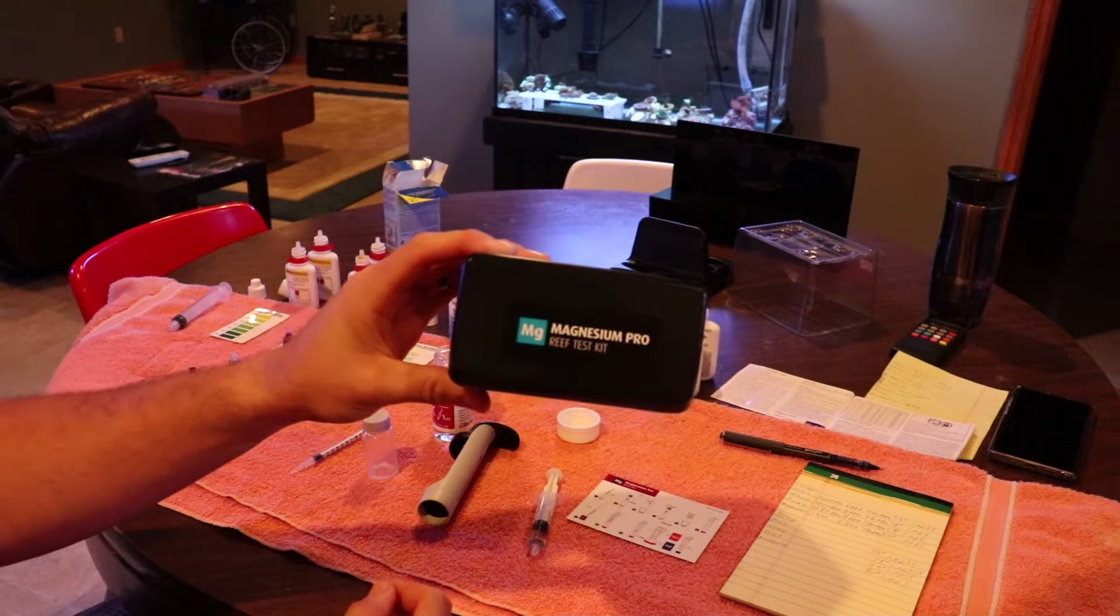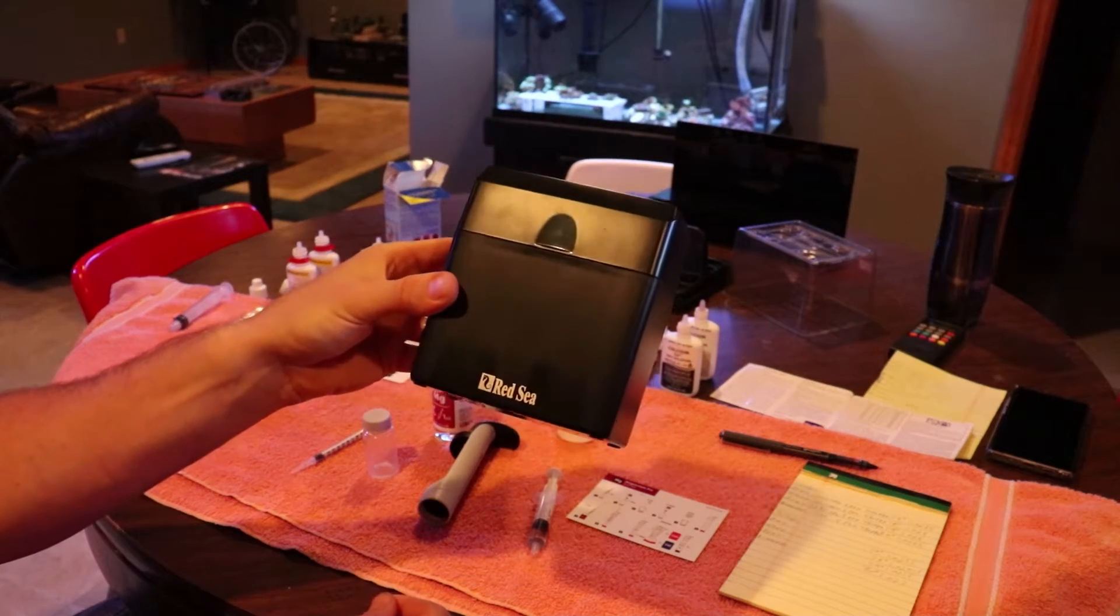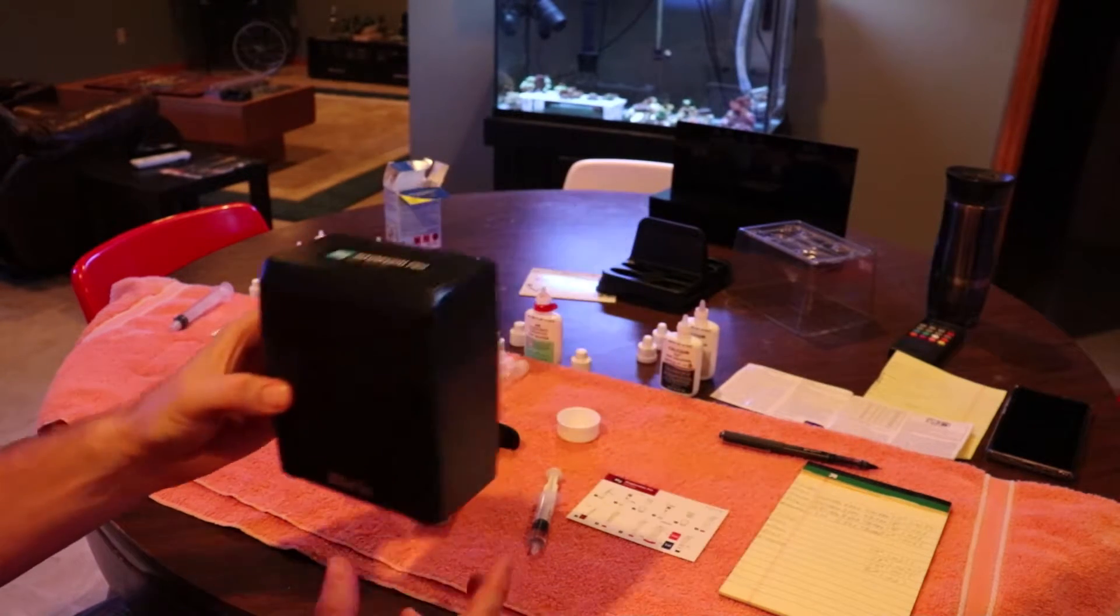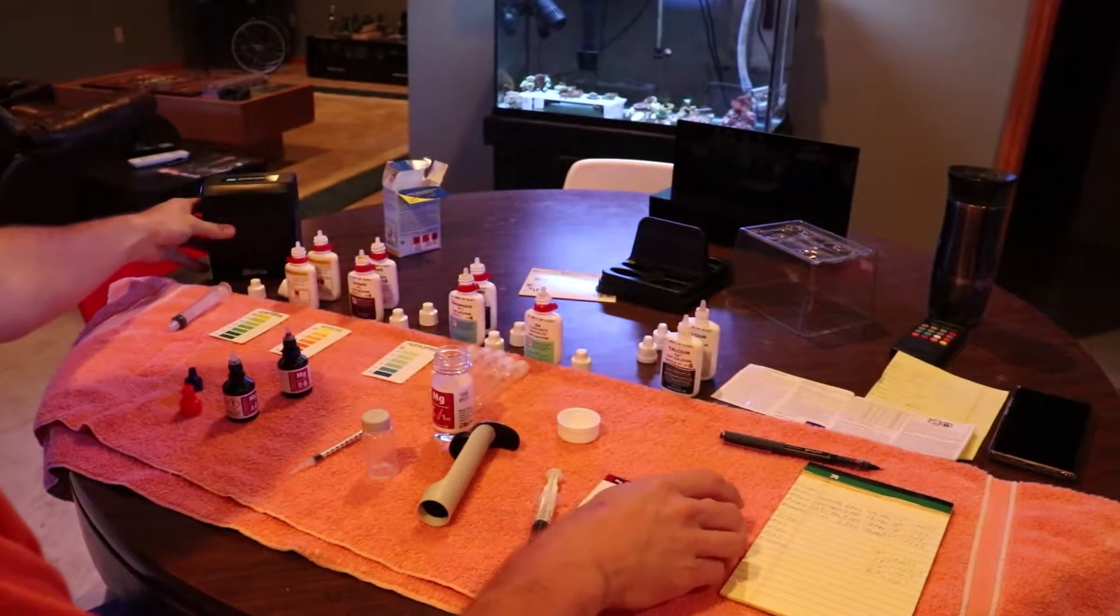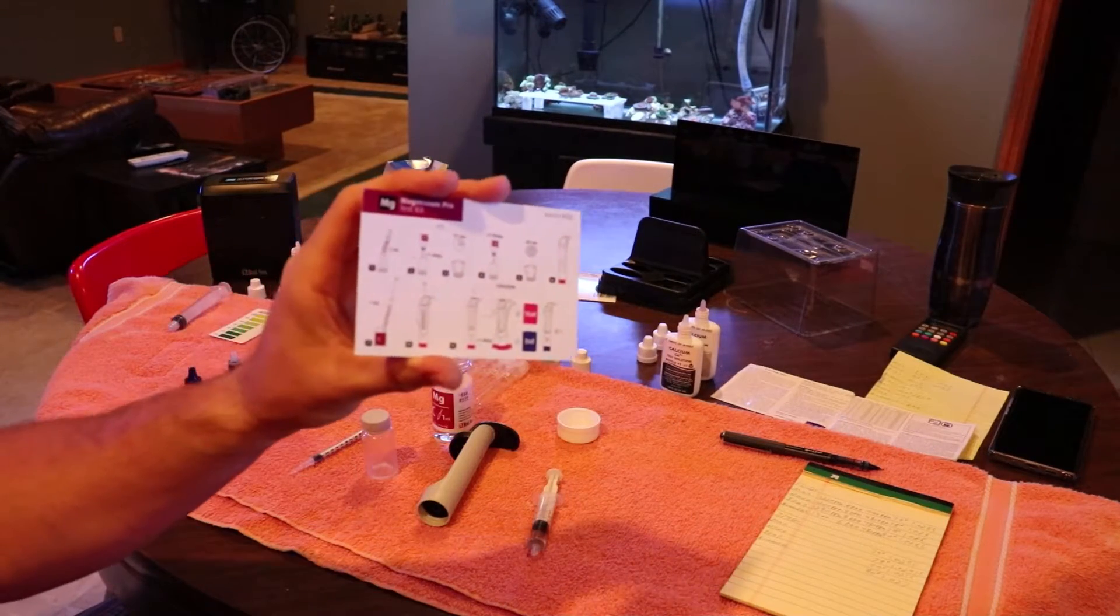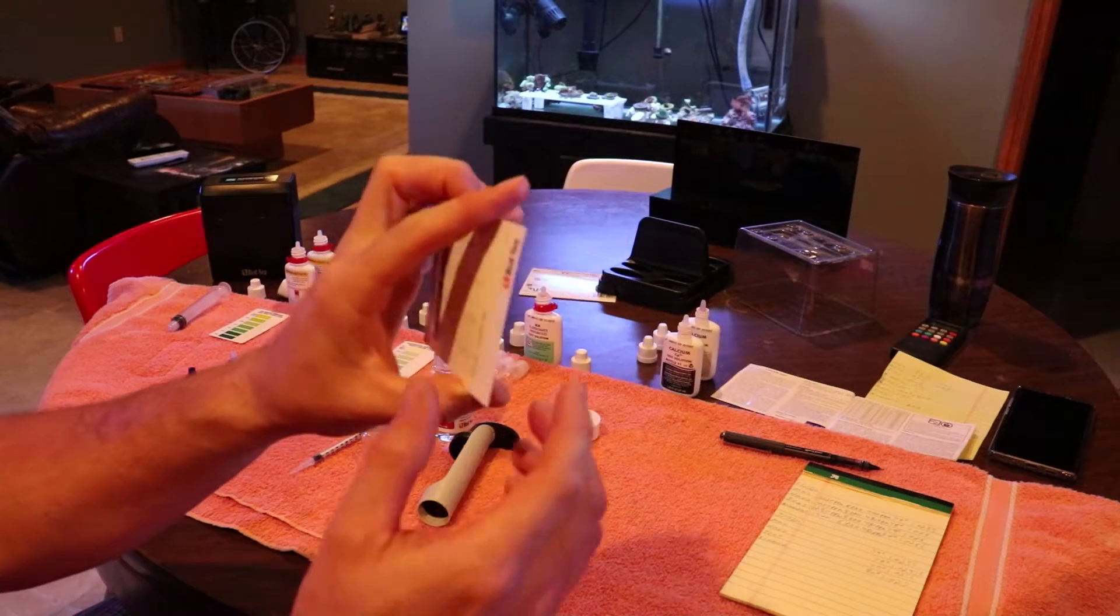Next we're going to go on to magnesium. Here I'm using the Red Sea magnesium pro test kit. I've been pretty happy with this kit, it's pretty straightforward on how to use it.